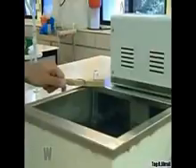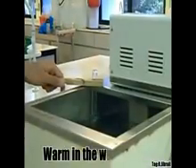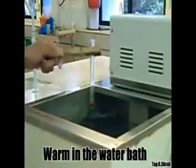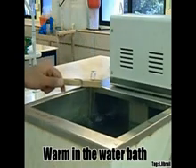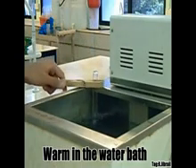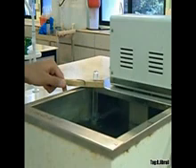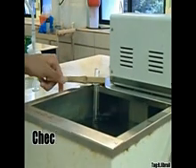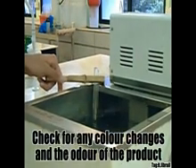Then warm in the water bath for about 2-3 minutes. Check for any colour changes or the odour of the product.